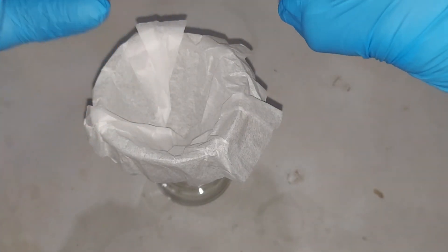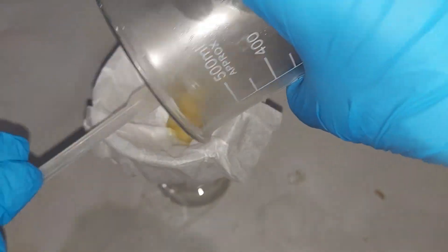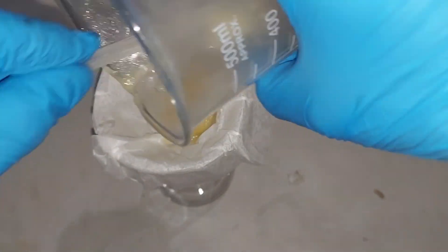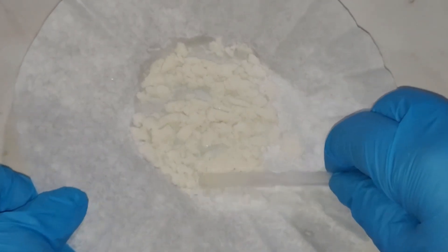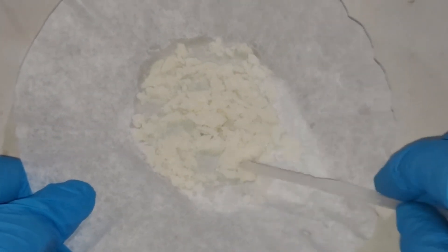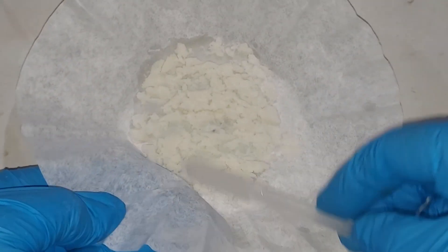Let's scoop all this into the filter. This is what washed out of the potassium carbonate — it's kind of an oily substance, hard to see on camera. I'm not sure what it is, but it did not mix with the acetone at the bottom of the flask. I just finished washing this with acetone and with some 100% ethanol. That oily substance was really interesting — I'm not sure what it was mixed in here.